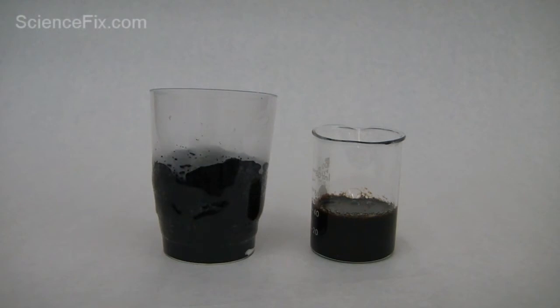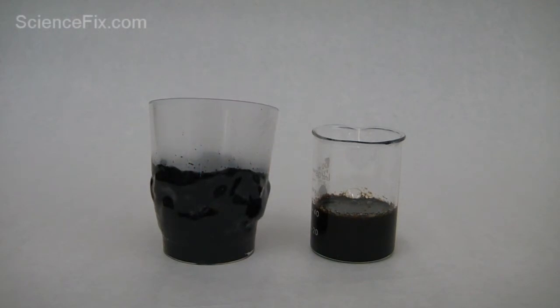And so you have that black carbon, and that carbon is going to be at solid phase, and that's what's kind of growing there. So you can see the heat that's being generated by this chemical reaction. It's an exothermic reaction. It's enough to melt the cup. It's extremely hot.